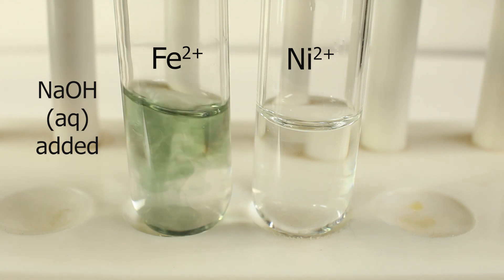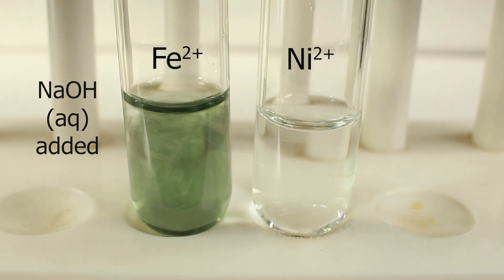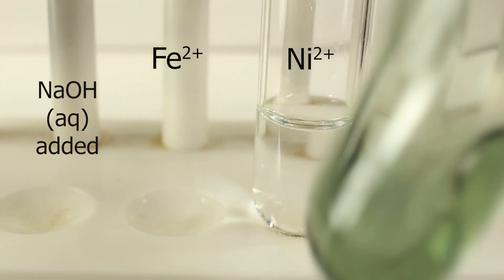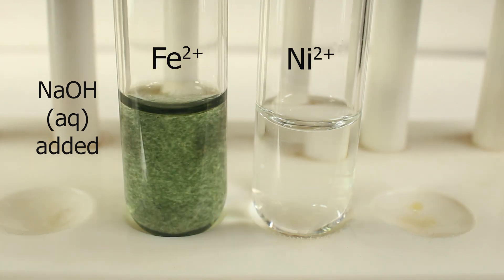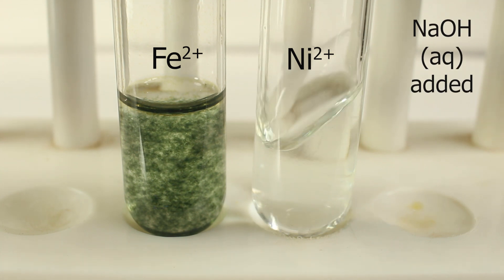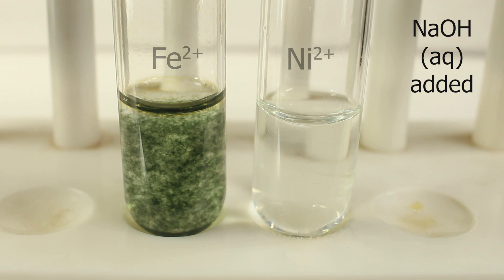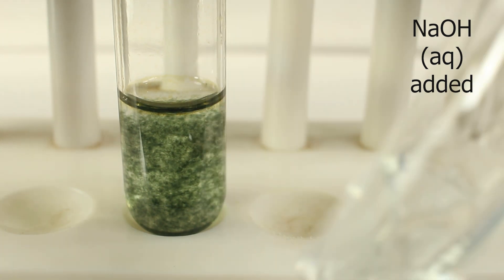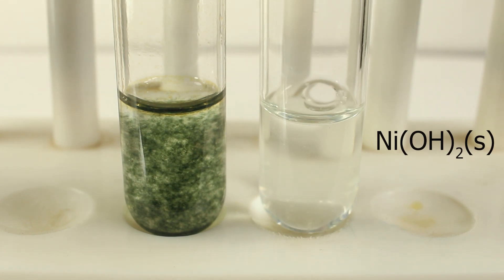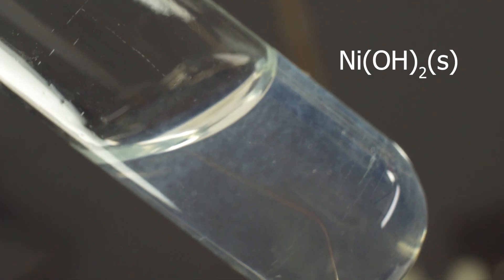Sodium hydroxide makes a precipitate of insoluble iron-2-hydroxide, which is characteristically green. With nickel-2, hardly anything is visible — the solution starts looking a little bit opaque. Maybe we see something if we shake. Not over a white background, but over a dark background you can see pale-pale green precipitate flakes.